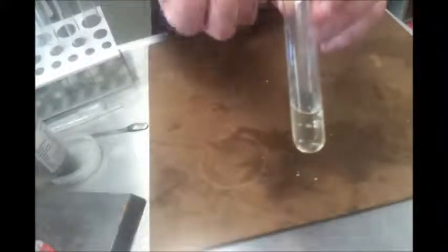If we put something like sodium hydroxide in there, it'll make a green precipitate. So we can see it more clearly there. Alright, so if you ever need to confirm that iron 2 is present, you just add some sodium hydroxide and it makes a green precipitate. What I'm going to add to this is a little bit of sulfuric acid, because we want this reaction to be acidic. So again, some sulfuric acid.